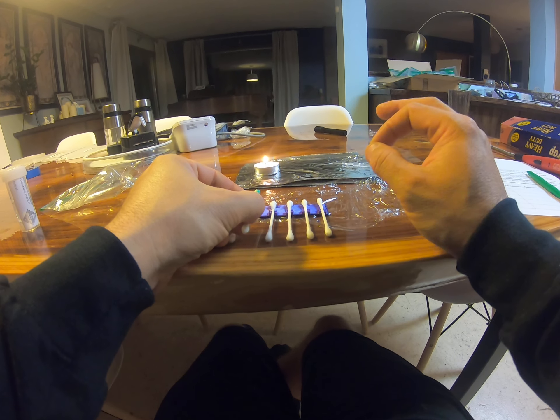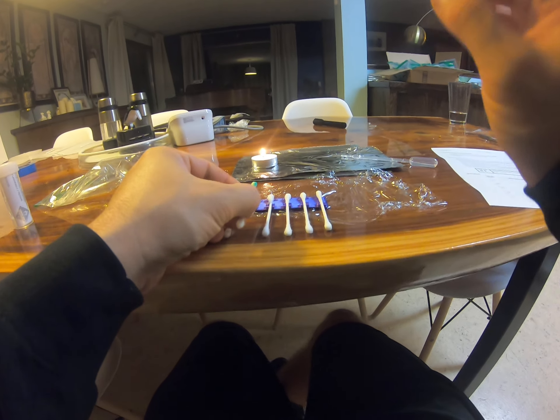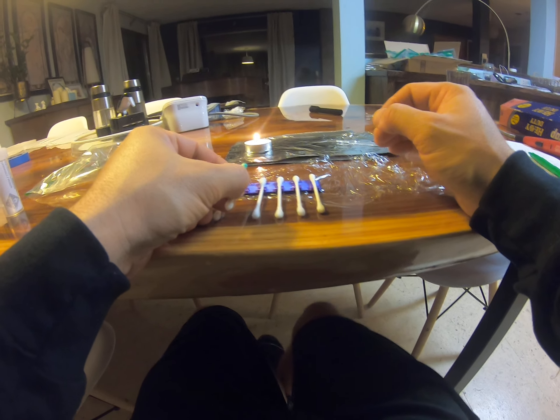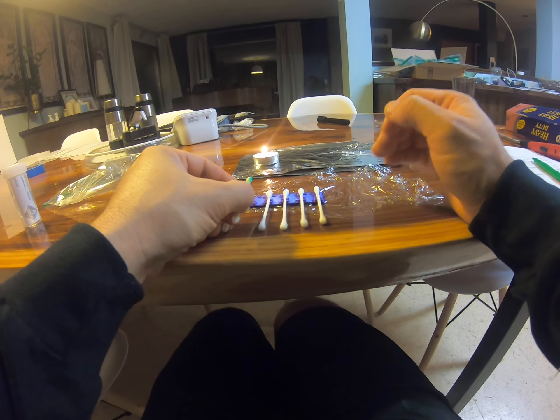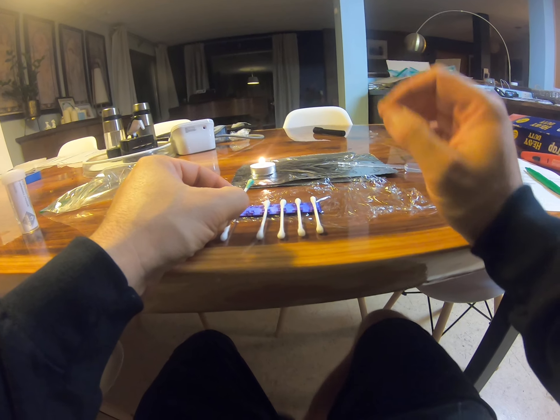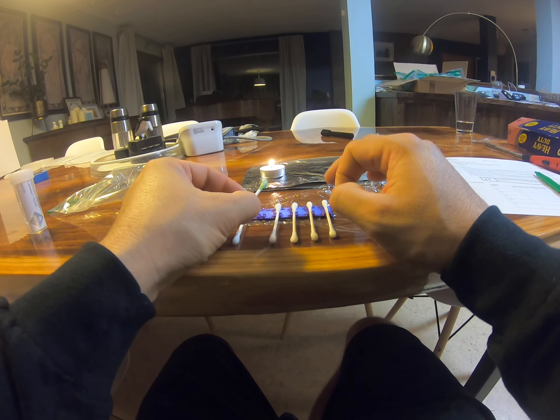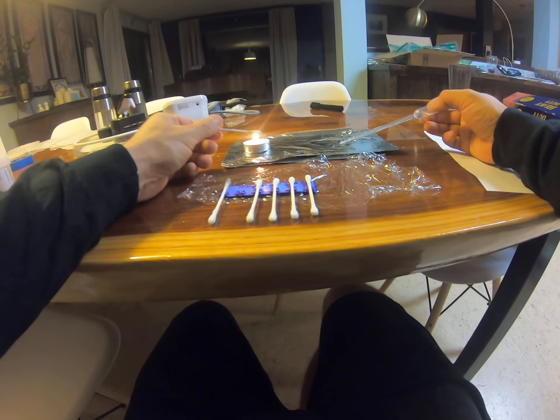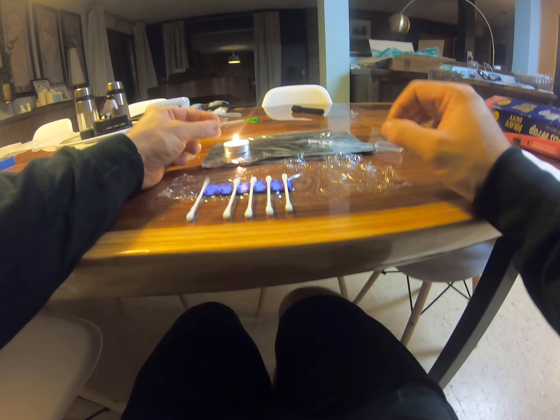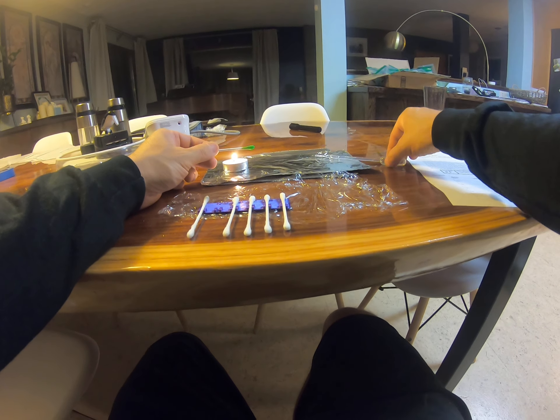What we're going to be doing is coloring that flame. When it runs out, after you know it's extinguished, you can add some more alcohol to it and relight it. So again, ethanol flame: blue with a little orange tip — not very exciting. I'll do the copper one with you because it's pretty impressive, and you can do the rest. You want to be careful not to touch the Q-tip heads together. They might be slightly contaminated because I had them stored in the same packet, but there's going to be a very characteristic color to each sample.